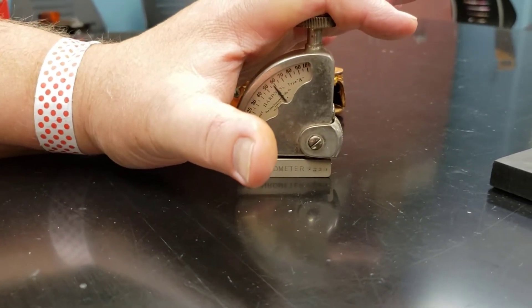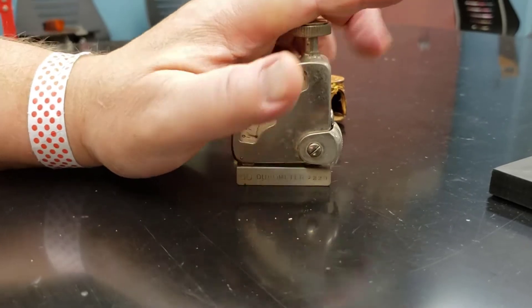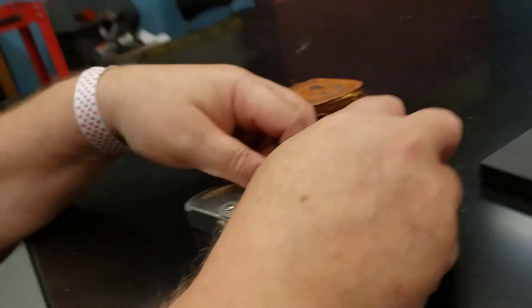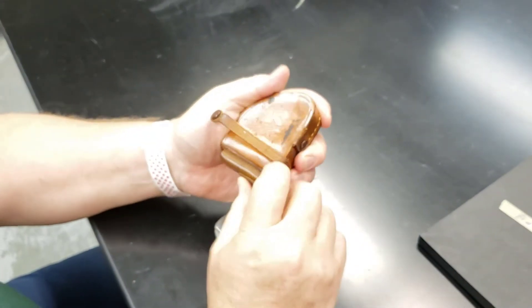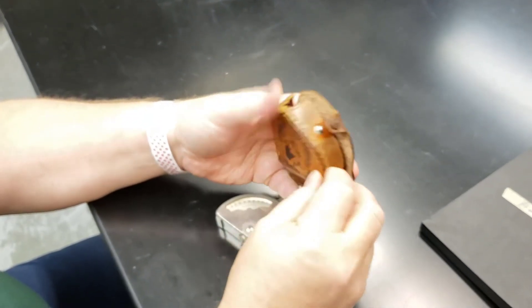You can see that's right at 60. So we're all calibrated and that just stores right here in the carrying case.